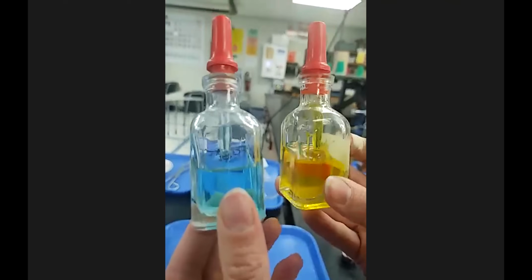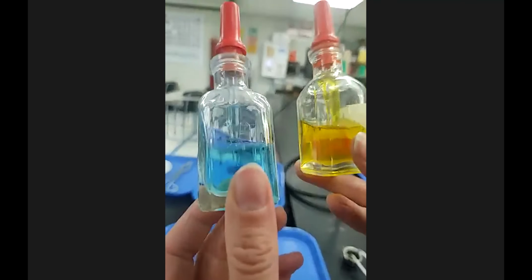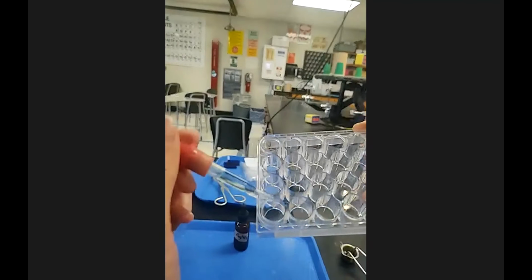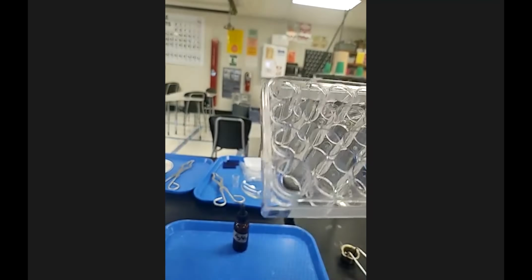They're both at room temperature. Very flowy. They're not thick liquids. They're pretty thin. And I'm going to add a couple drops, that's 3 to 4, of the copper 2 chloride to a well plate. I'm going to do it in this corner here. 1, 2, 3, 4. Remember, you don't need a lot of something to see a reaction.